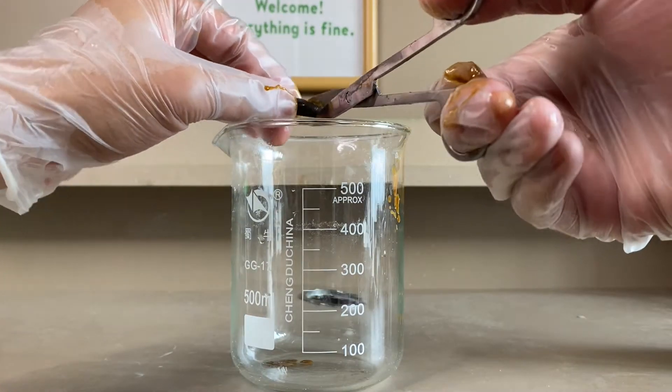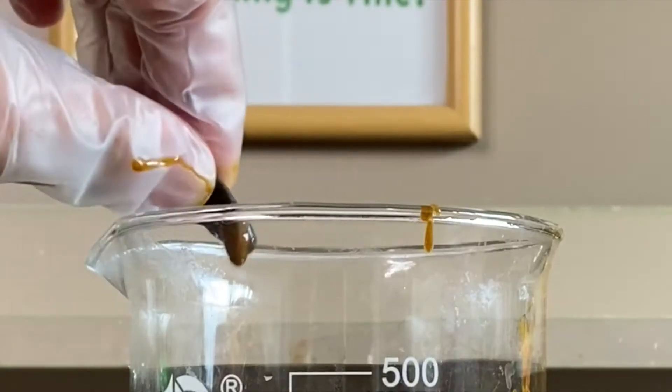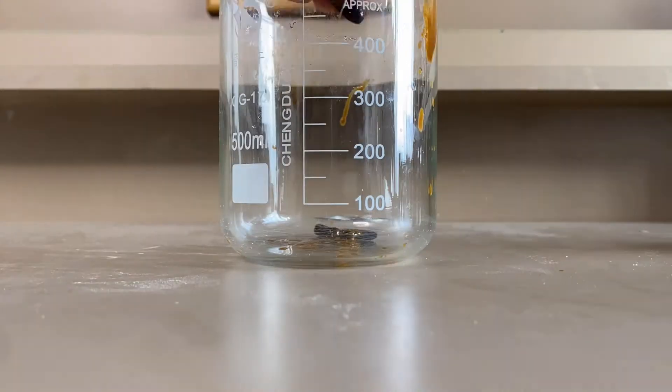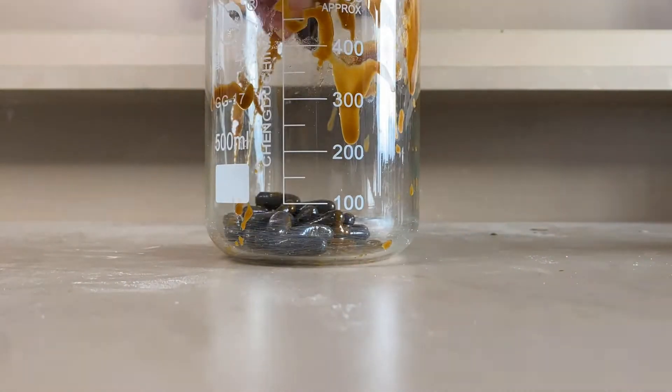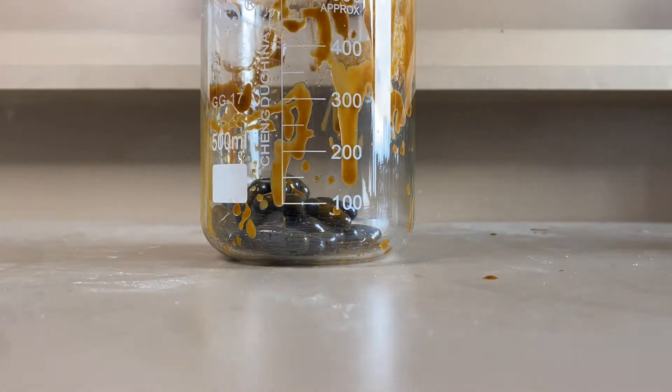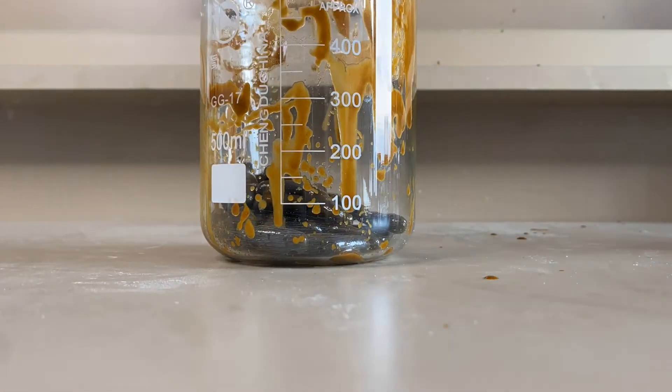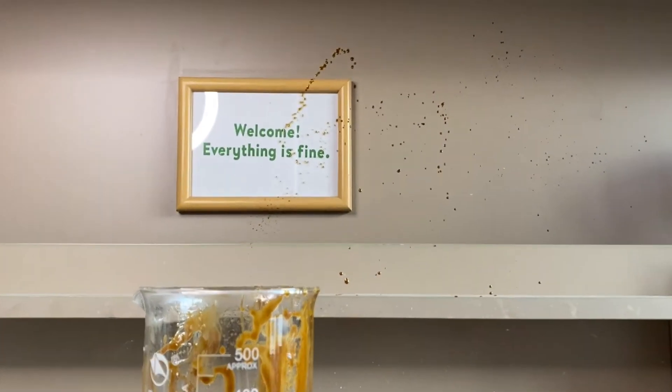The first thing we need to do is to cut the pills and squeeze out the contents into a large beaker. Overall, the process is messy and disgusting and by the time I'm done, the workplace is covered in shit.